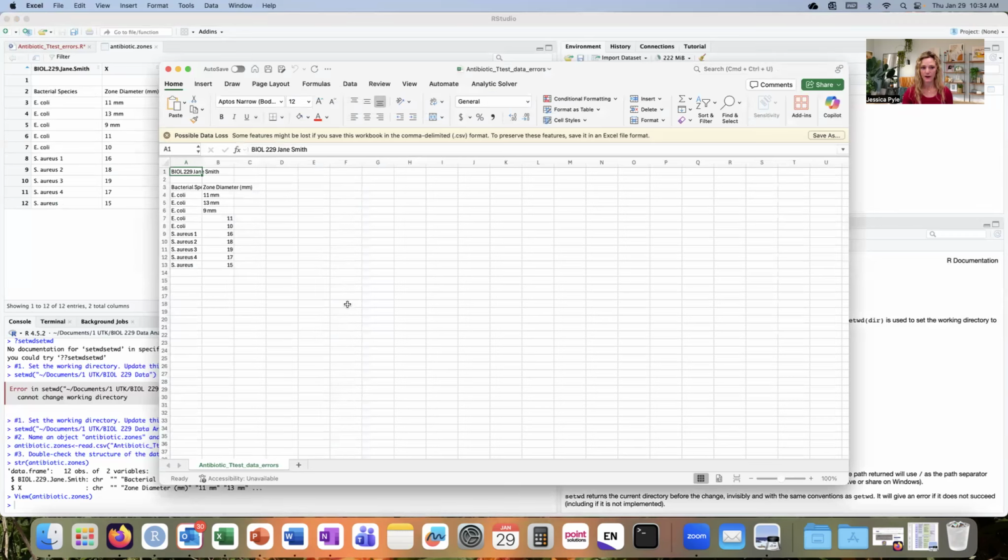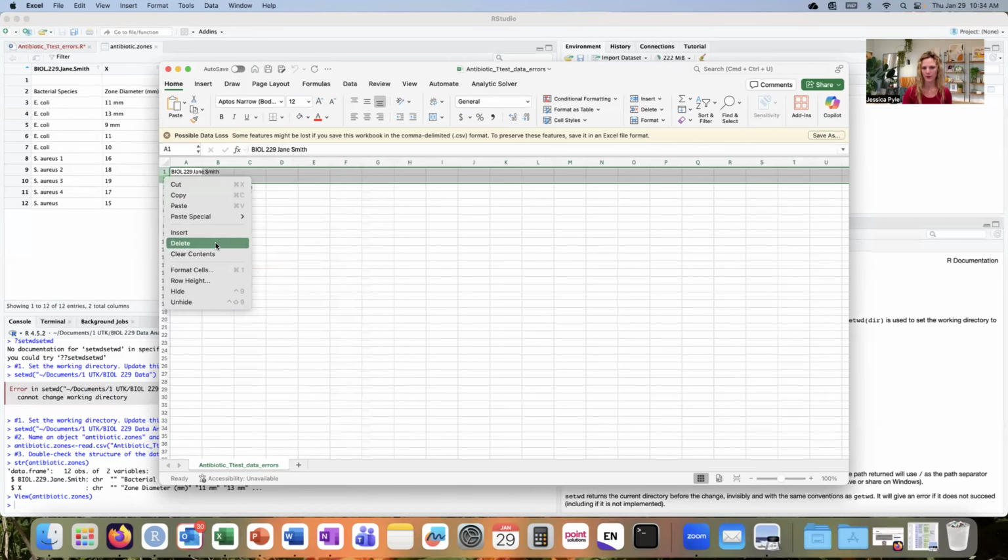And I can see why R imported those two column headings, because it's always going to import whatever's in row 1 as the column heading into the CSV because of the way that we've got the default parameters set. So when this student saved this data file, they put the class name and their name within row 1 in column A. And that's going to create problems with the way that R imports this data file. So we don't want to have anything in row 1 or 2 that's not related directly to the data that we want to analyze. So I'm going to just delete those 2 rows.